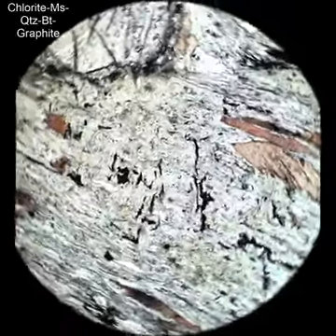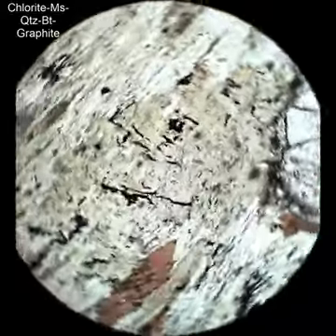This chlorite has some interesting textures. There's some pleochroic halos. There's one big one. There's a bunch of little ilmenite inclusions in there. That could be because it formed as a retrograde product after biotite. Biotite has a lot of titanium in it. The titanium doesn't go into chlorite, so it forms ilmenite. But you can see some deformation in here and that same sort of weird chlorite interference colors.